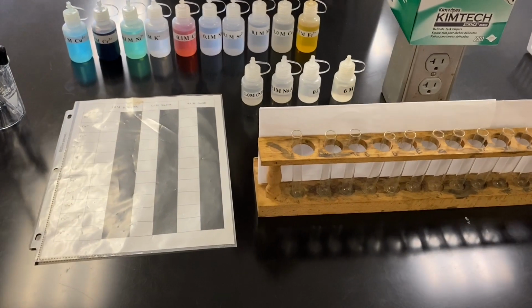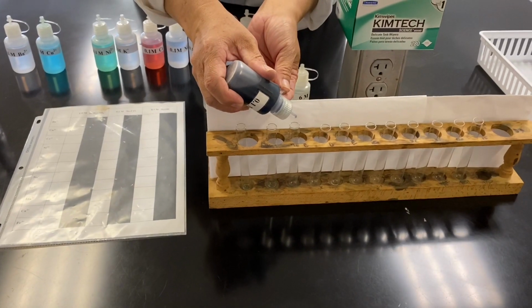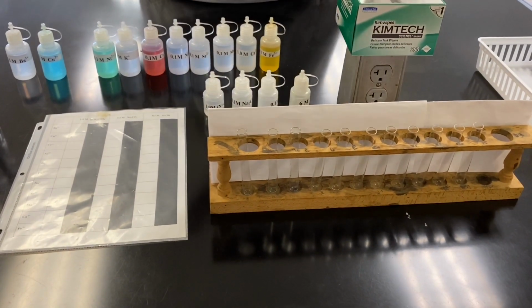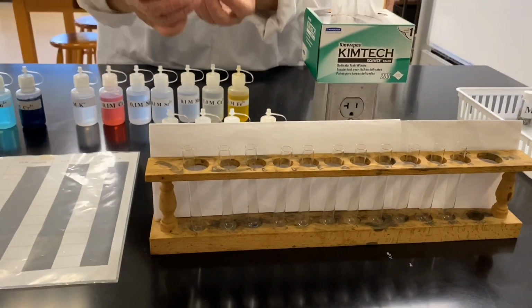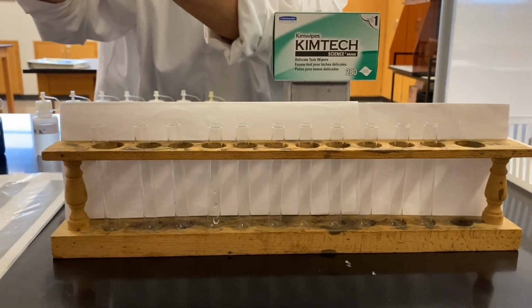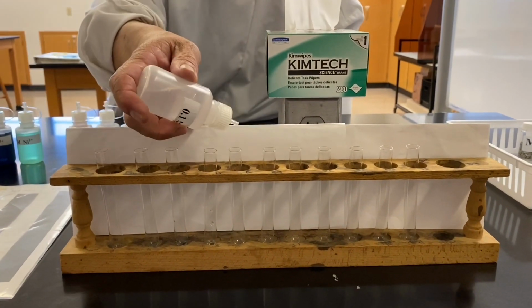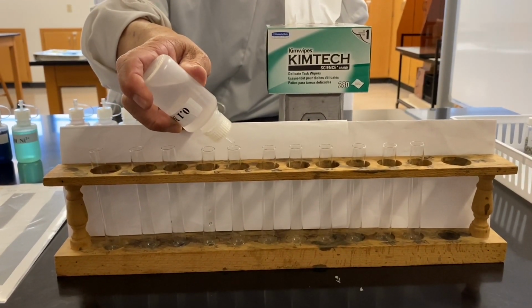We will now proceed to step B of this exploration. If you compare the reaction sheet and the table on page 49, we see that the column of reaction with ammonia is missing on this sheet.